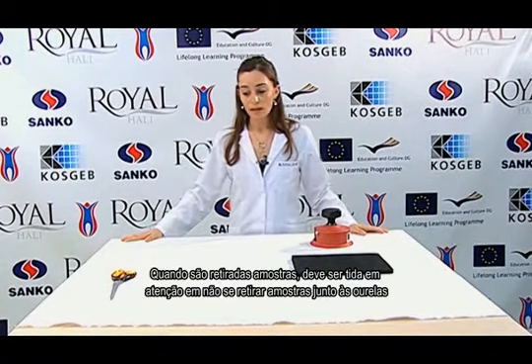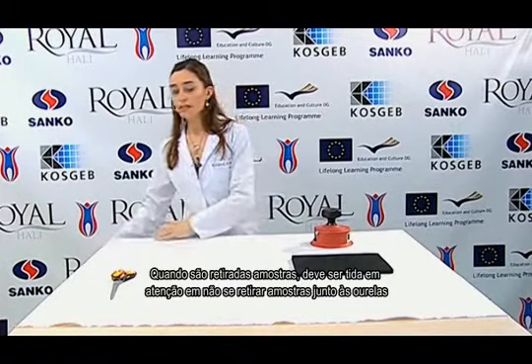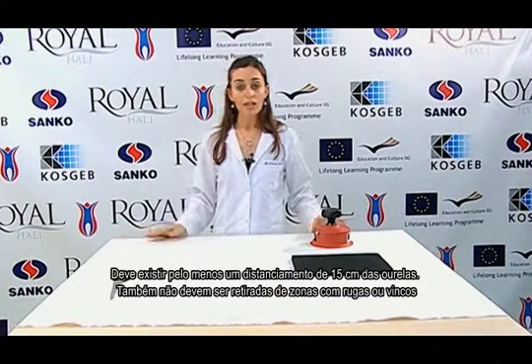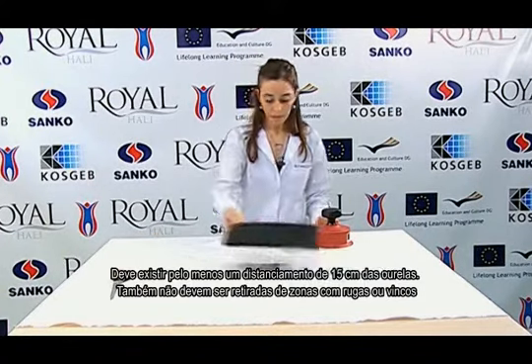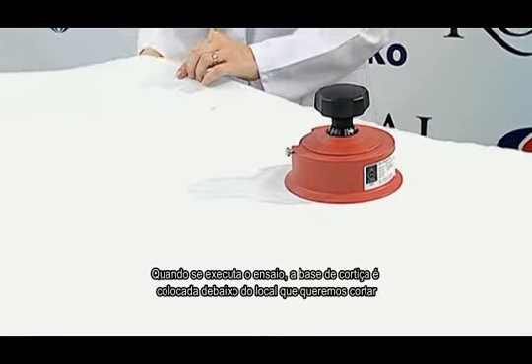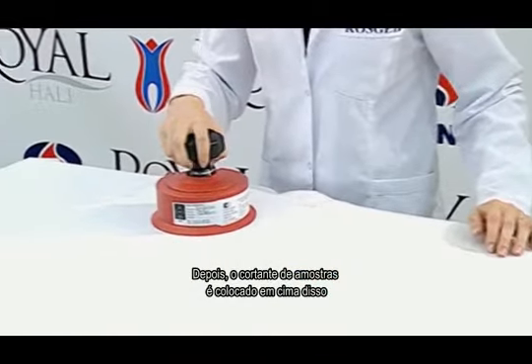When taking the samples, attention should be paid in order not to take the samples from parts close to the edges. At least a 15 centimeter space should be left from the edges. Moreover, samples should not be taken from places where there are wrinkles and fold traces. When performing the test, the cork plate is placed under the point that we want to cut from. Then, the sample cutter is placed on it.